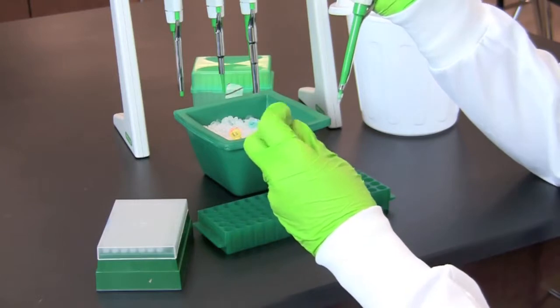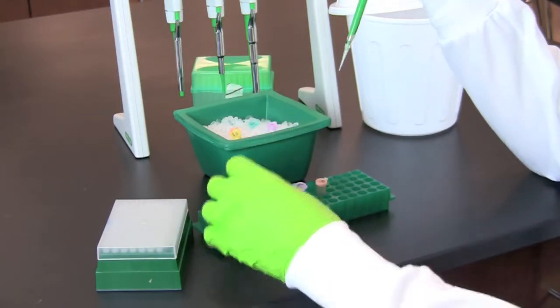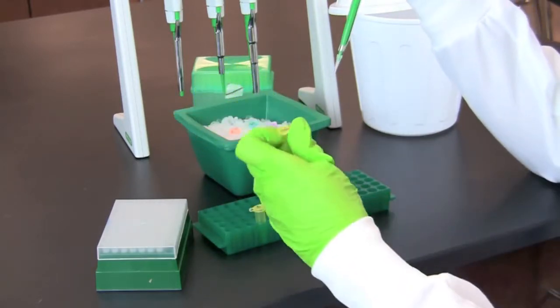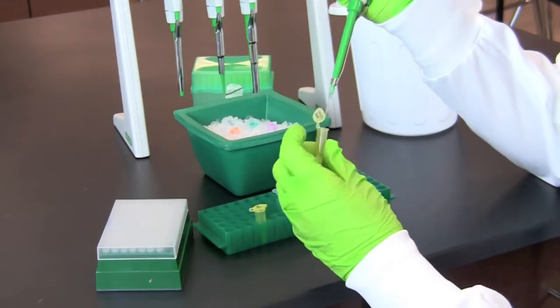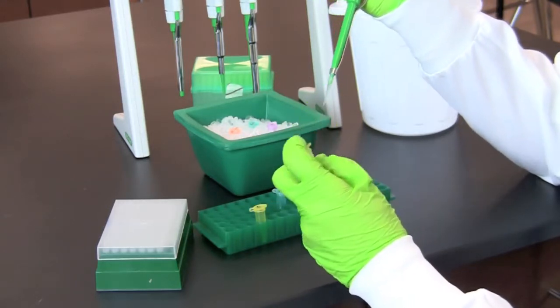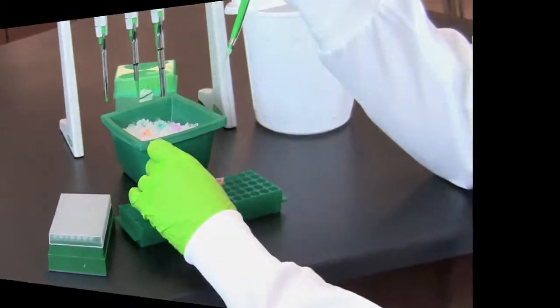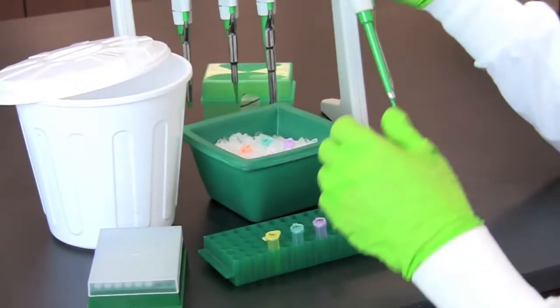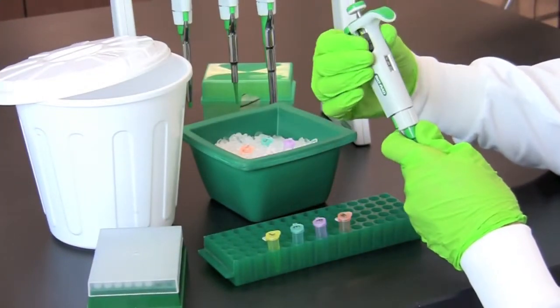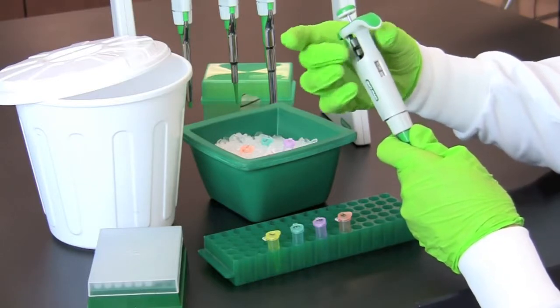Continue this procedure for transferring lambda DNA to the other color-coded sample tubes.